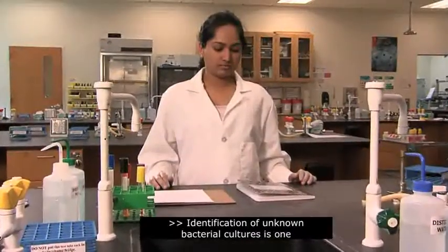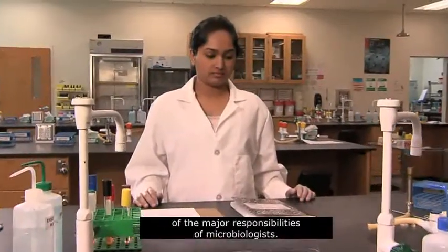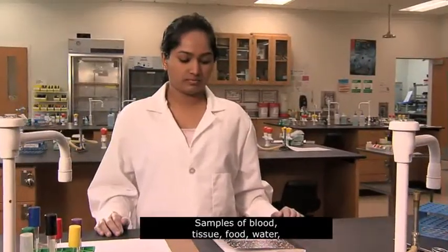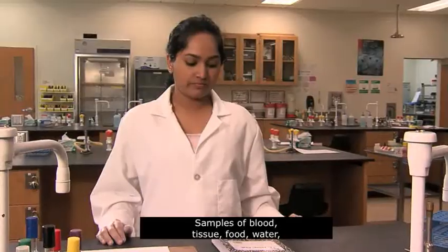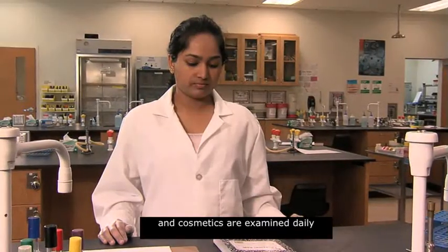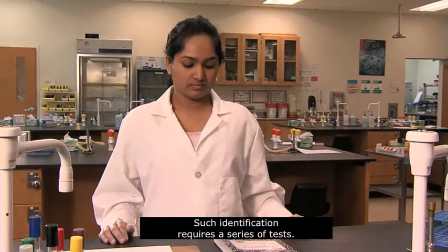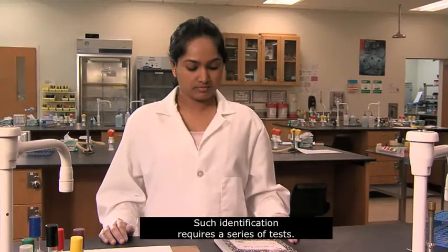Identification of unknown bacterial cultures is one of the major responsibilities of microbiologists. Samples of blood, tissue, food, water and cosmetics are examined daily in laboratories around the world. Such identification requires a series of tests.